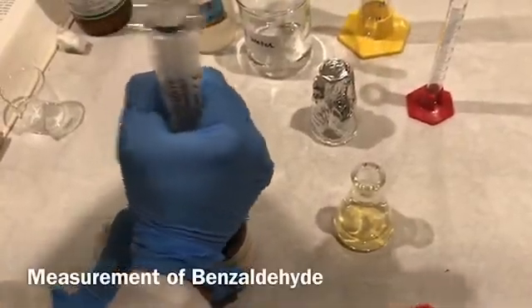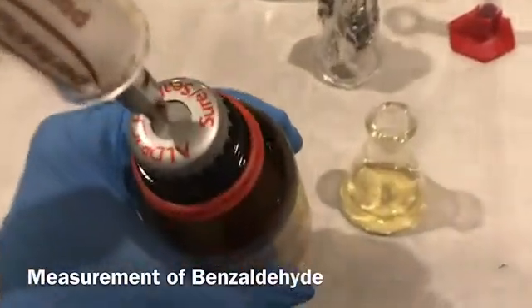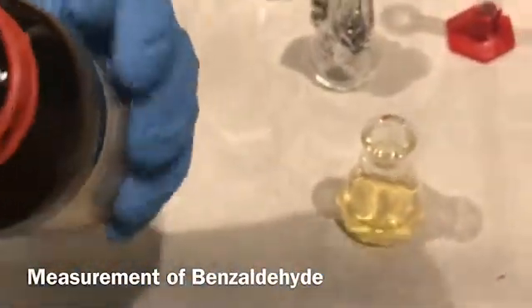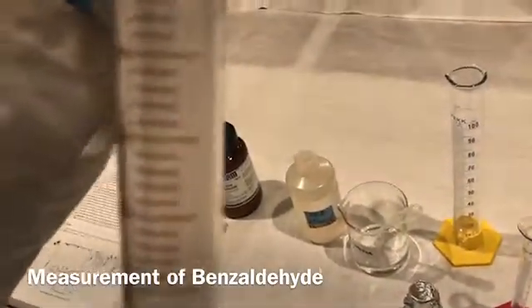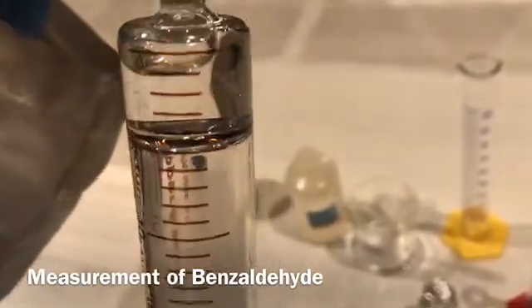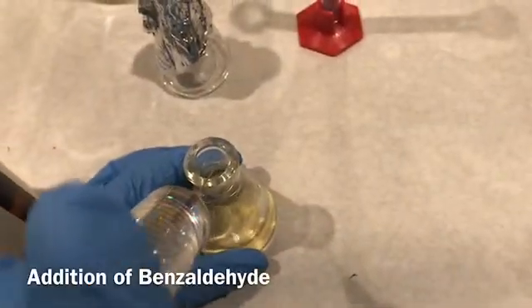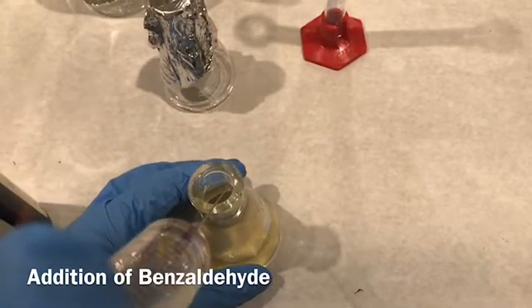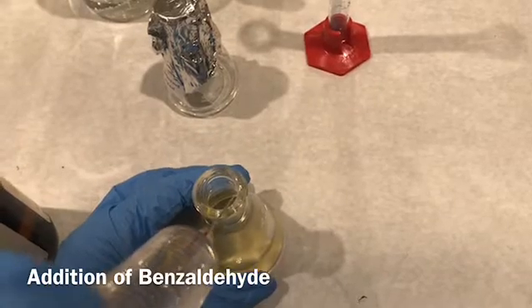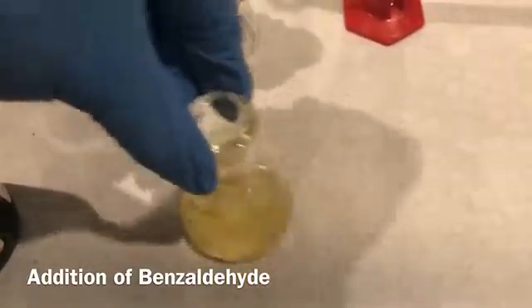I am taking the benzaldehyde from this bottle — it has a septum in it, as you can see, and I am poking the syringe through it to draw out 4.5 milliliters of benzaldehyde. Now I am dispensing the benzaldehyde into the flask. You can observe it still looks pale yellow.